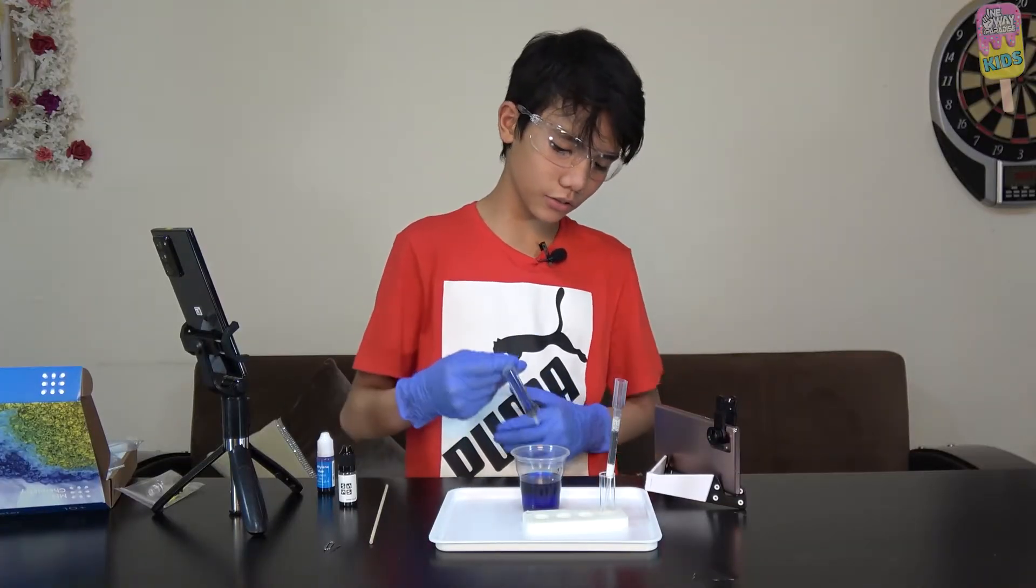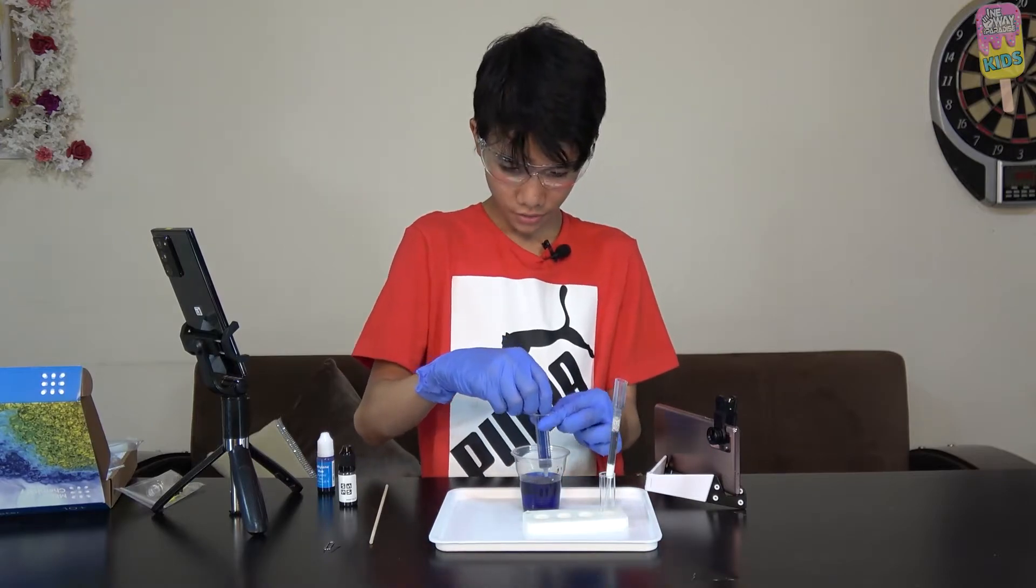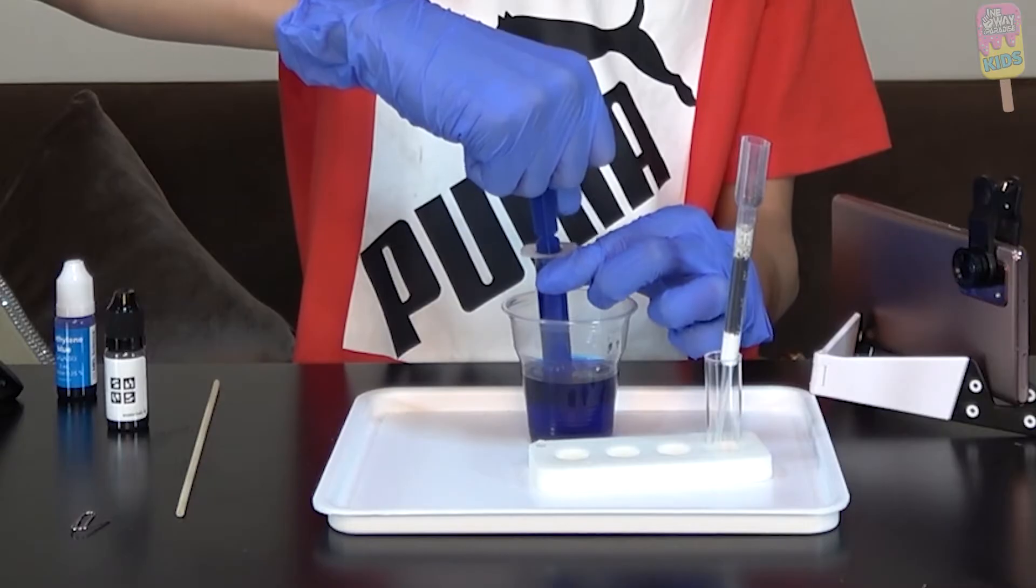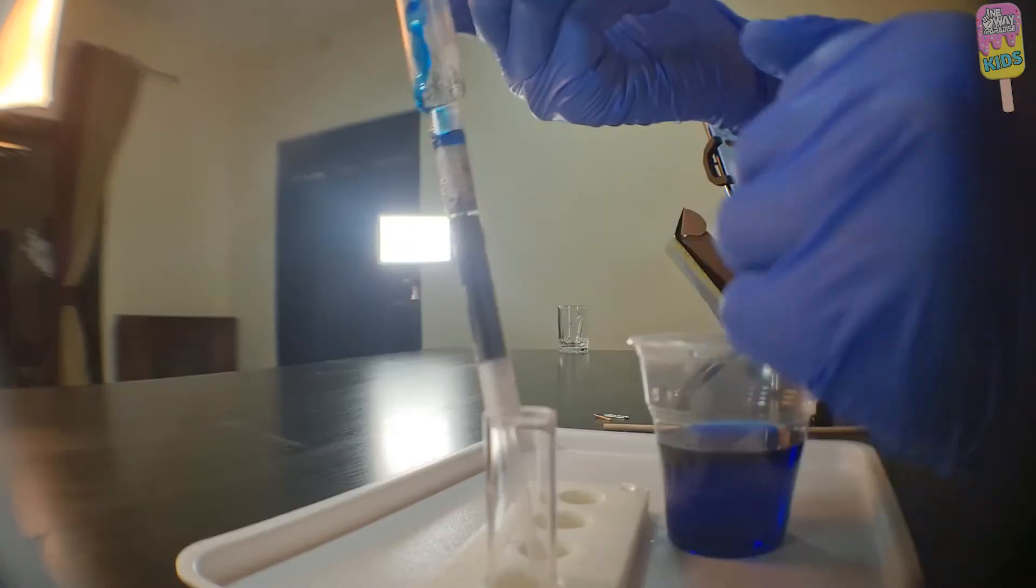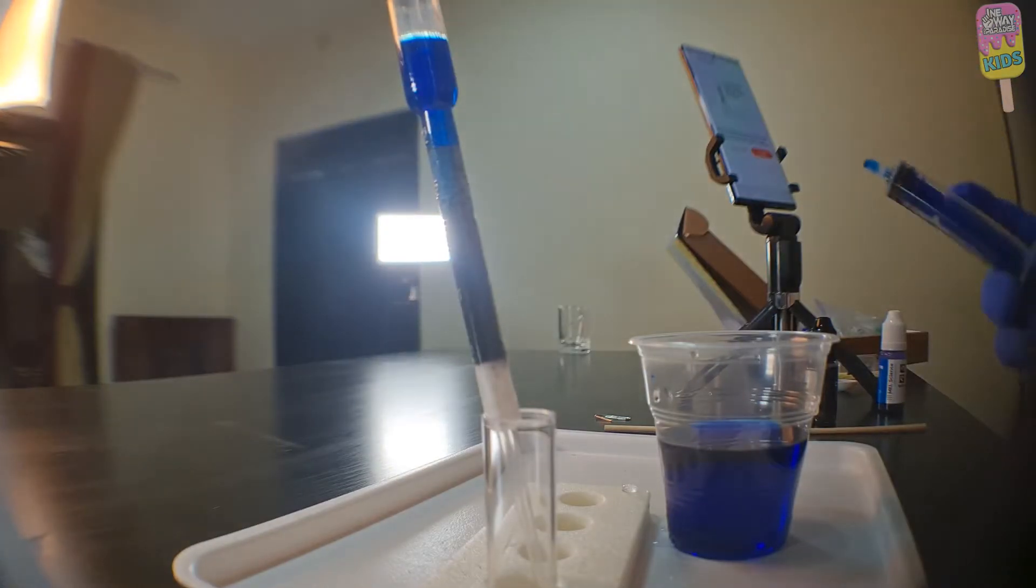What I'm going to do is use a syringe to transfer the solution into the carbon filter. Here we go. Bismillah. Now we wait.